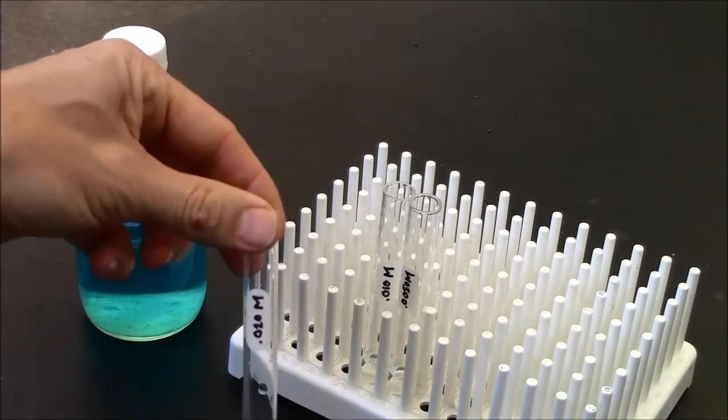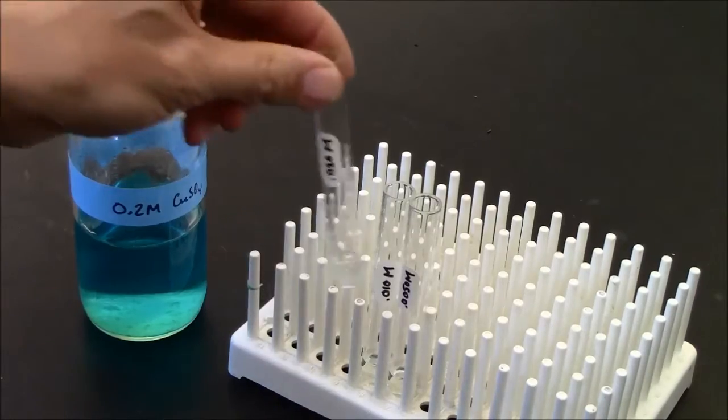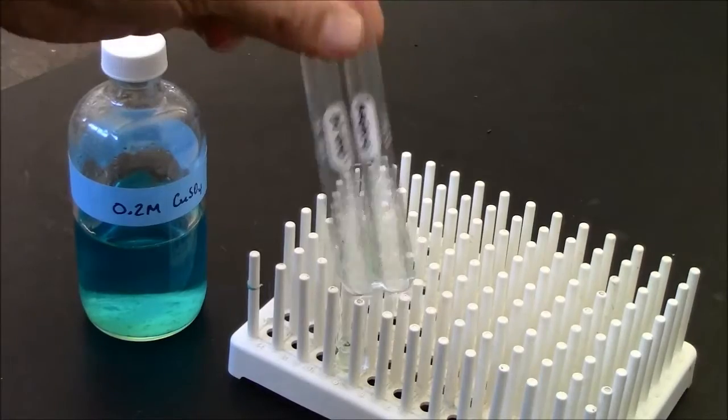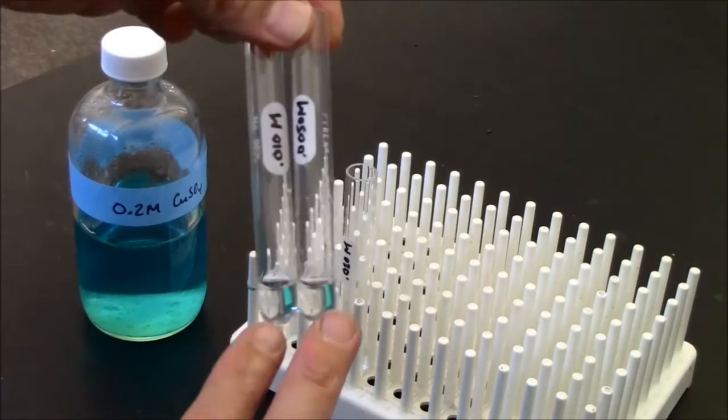Well, if the solution is very dilute, then you may not be able to see the blue color. So here I've made dilutions of this copper sulfate solution, and to my eye these are colorless.